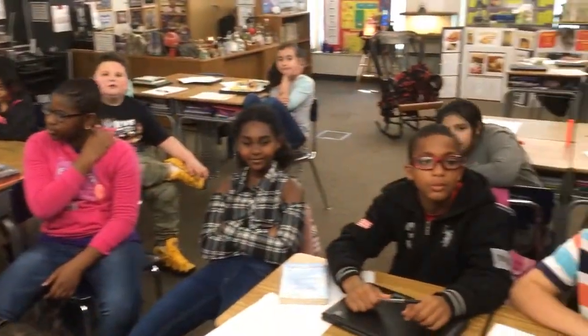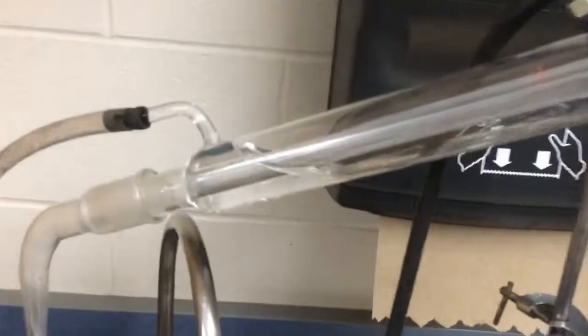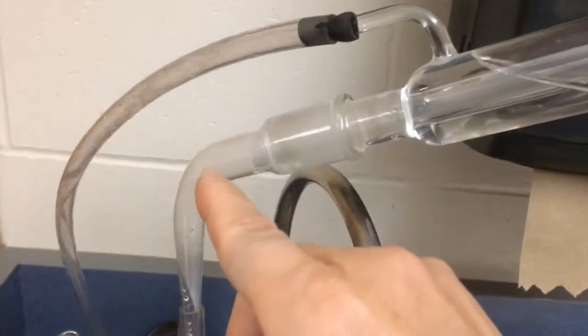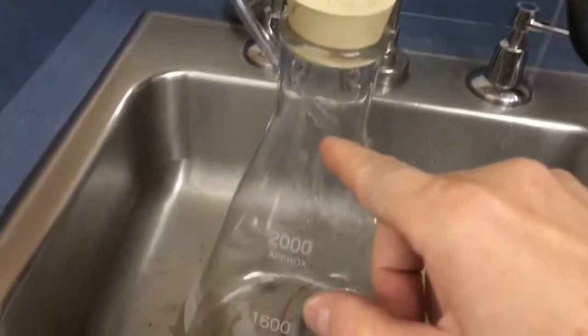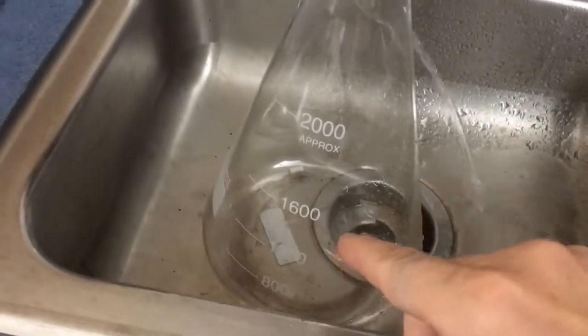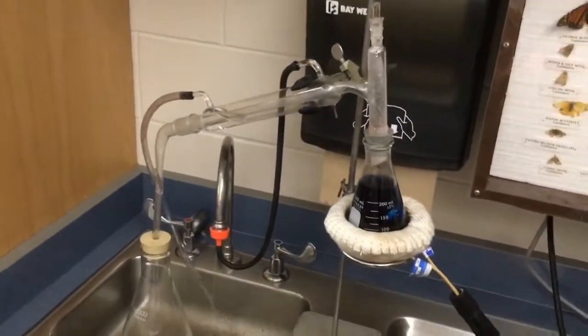It rains, and there's a fancy word for rain. What's that fancy word? It starts with a P. Precipitation. And so when I look at our distillation tube, we're going to have that water vapor condense like in a cloud, and it's going to start to drip down into our second flask here, where we want to find pure water. We don't want polluted water. We want water that precipitates after it condenses in a cloud. And so as it rains down, we have precipitation, and then our fourth step is collection.